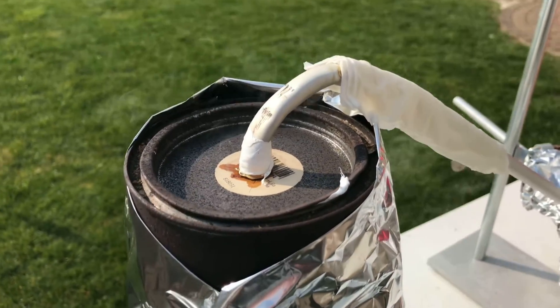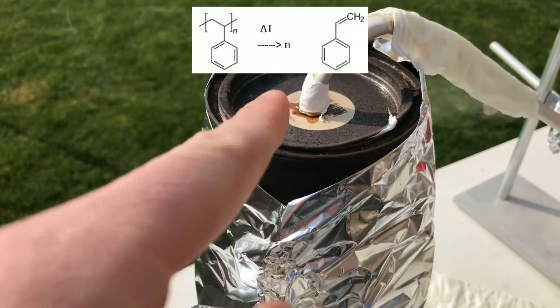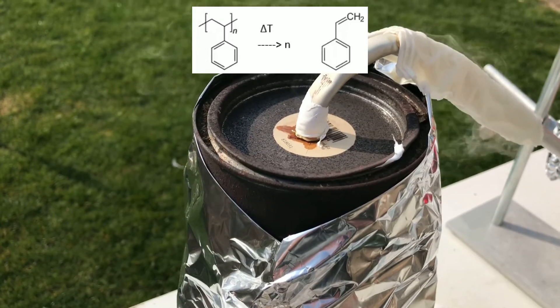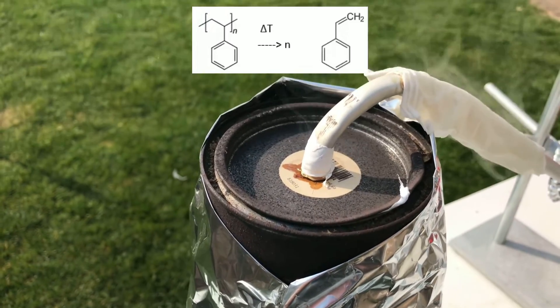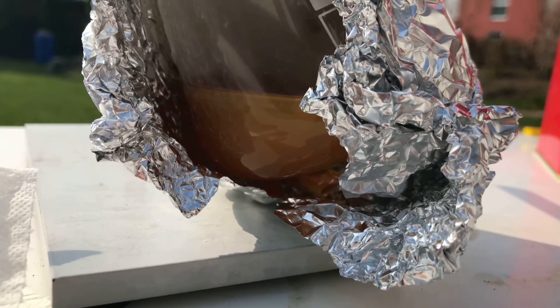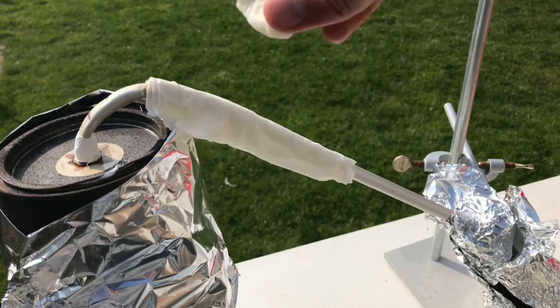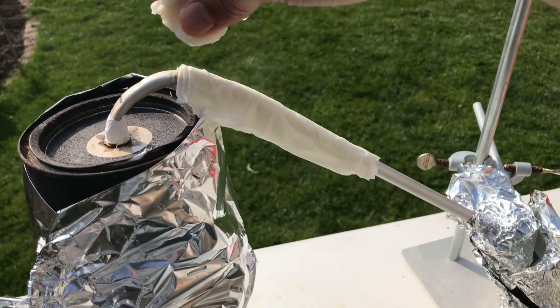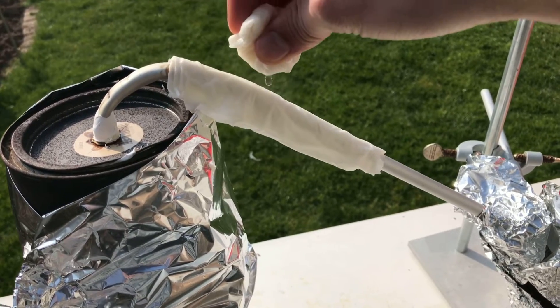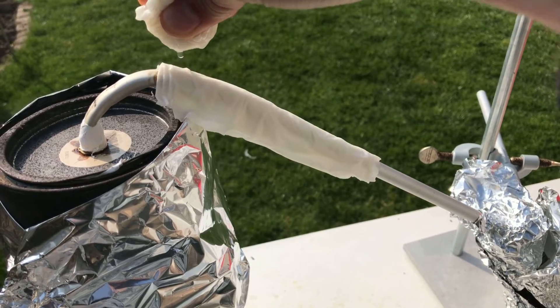The efficiency of the condenser was increased by adding a wet piece of cloth. The main reaction going on is the polystyrene decomposing to styrene, though some other side reactions are still taking place. As the reaction continued, we collected more and more crude styrene. To keep the condenser efficient, some fresh water was added occasionally. You can really see how hot it gets. Styrene has a boiling point of around 145 degrees Celsius.